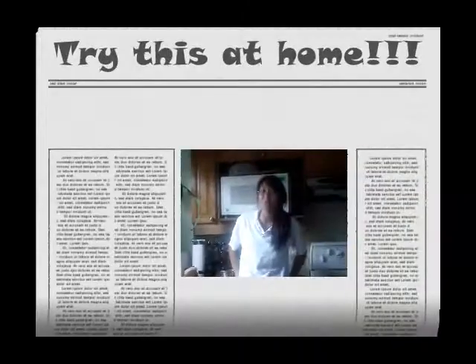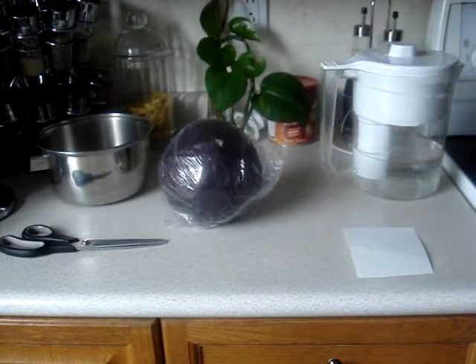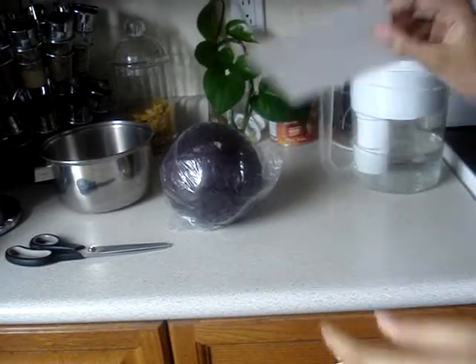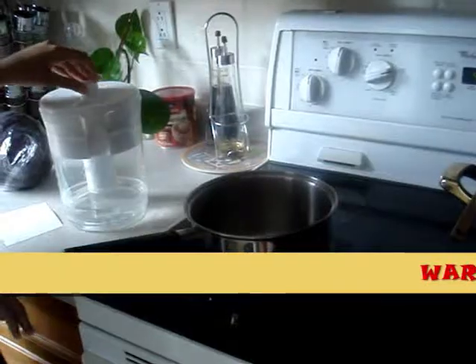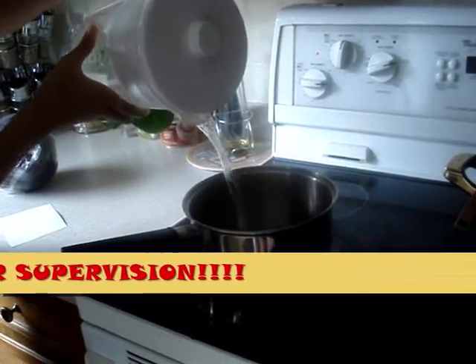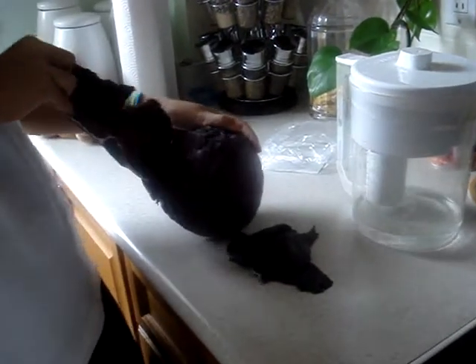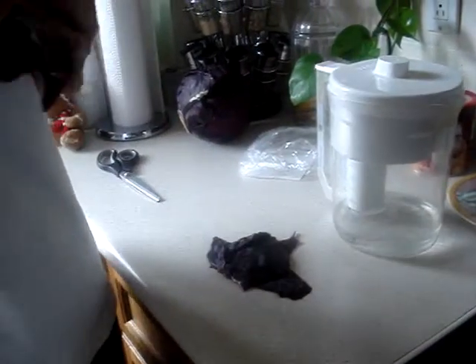Try this. Have you ever wanted to know if anything was an acid or a base? Well, now you can with your own litmus paper. Things you'll need are red cabbage, a pot, some hard paper, some scissors, water, and a stove. First, turn on the stove and pour in some water. While the water is boiling, rip up some red cabbage into small pieces and put them into the pot.